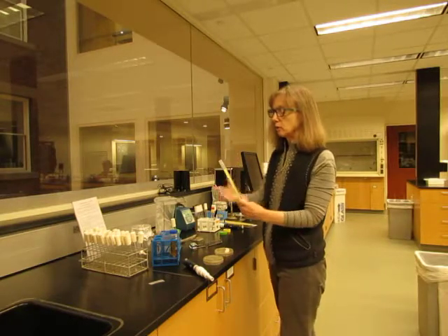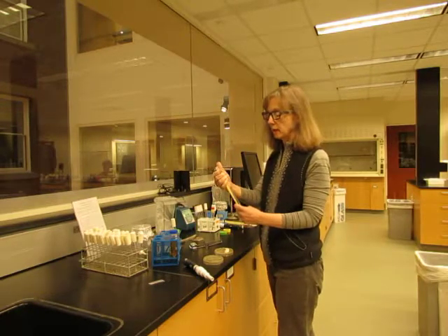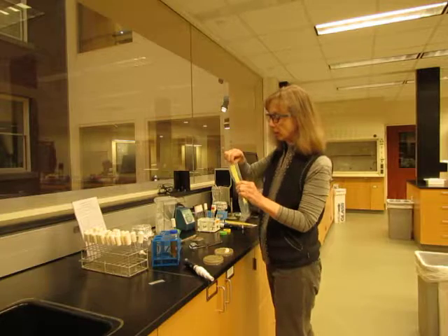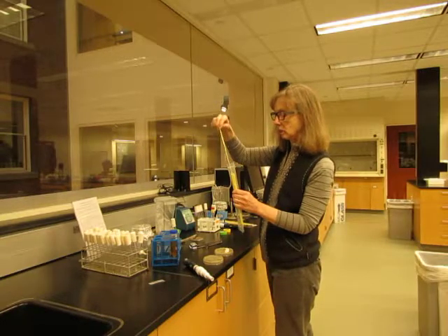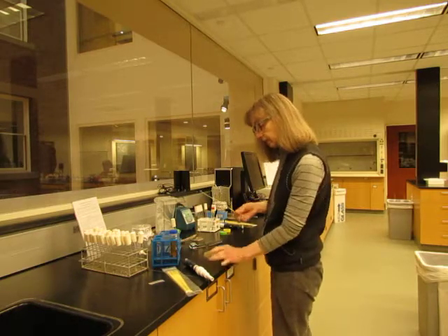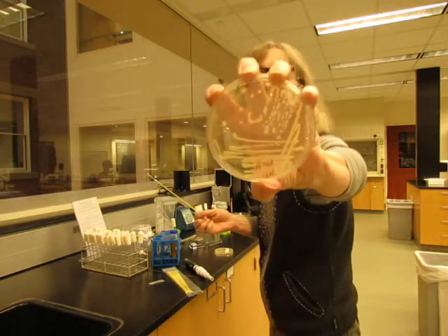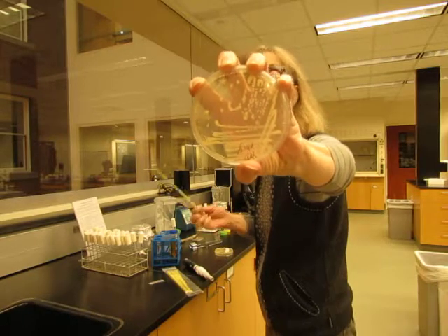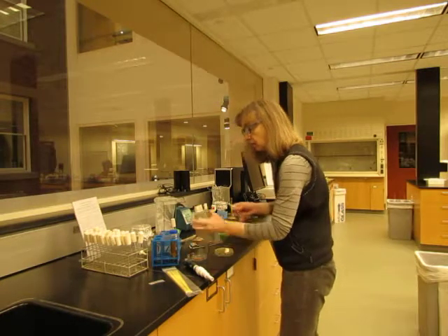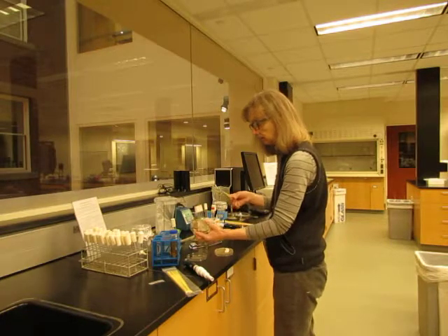When obtaining your loop, you don't want to put your hands all over the inside of the bag because that would contaminate it. So push up some of the loops and grab one, trying not to touch the edges of the bag at all. The plates provided have individual colonies on them and you want to grab one individual colony — go ahead and grab a colony, and they're pretty sticky so it's easy for it to stick to the loop.